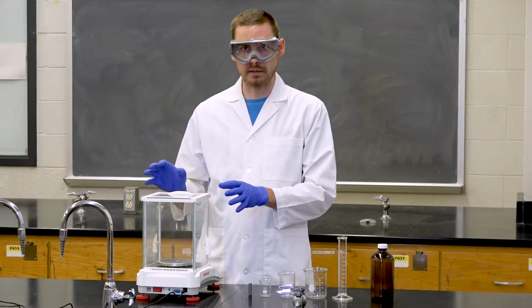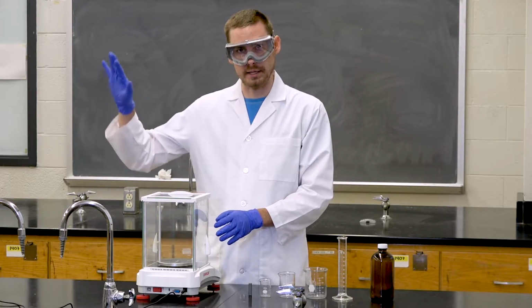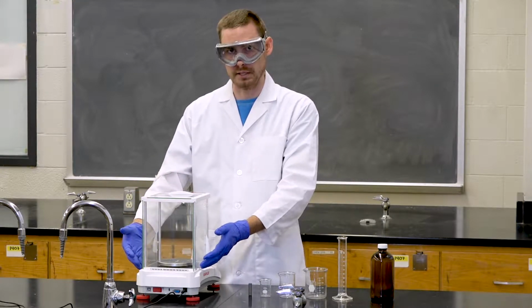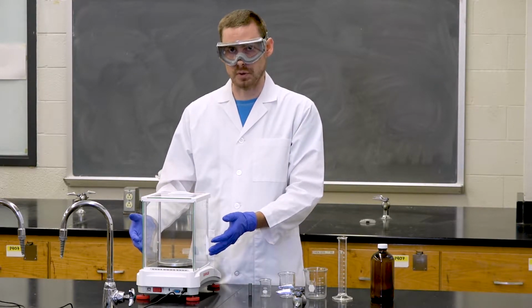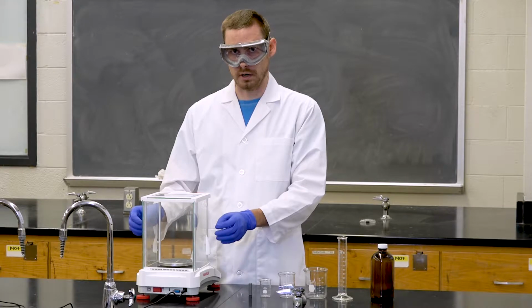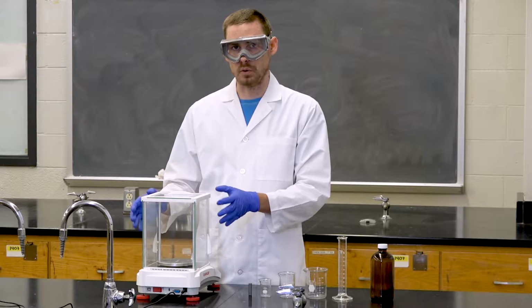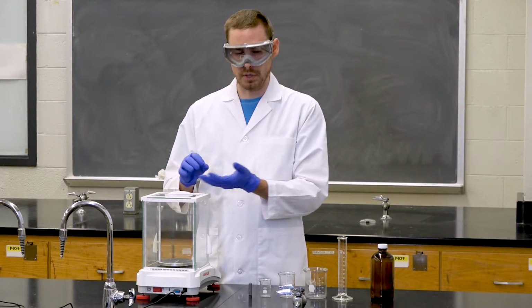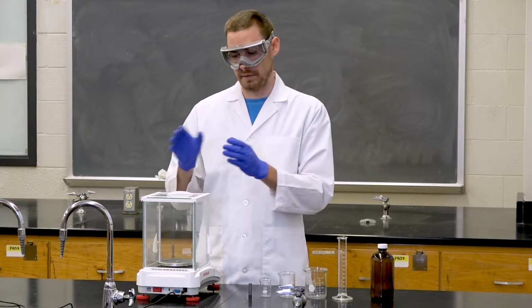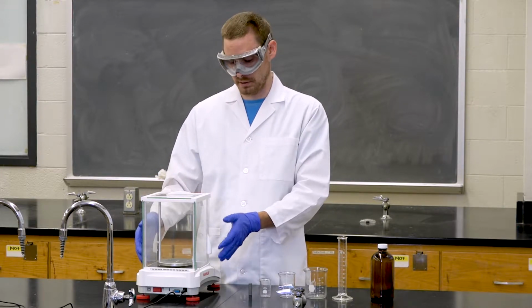Whenever you're measuring using an analytical balance, you want to make sure all the doors are closed as you're measuring. This will prevent any wind currents from coming through and disrupting your measurement. You also want to make sure that the balance stays very clean. If you spill any chemicals or water inside the balance, remove those carefully using a brush so as not to harm the balance itself. And one last thing is to never add chemicals or water or solids to a weigh boat or a beaker inside the balance. First remove the beaker from the balance, then add your water, and then place it back in the balance. This will prevent you from spilling any chemicals inside of the balance.